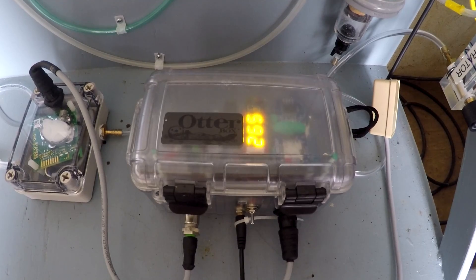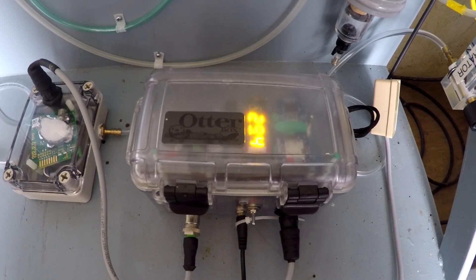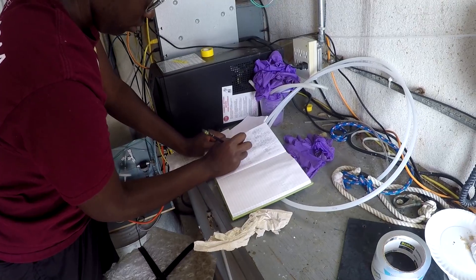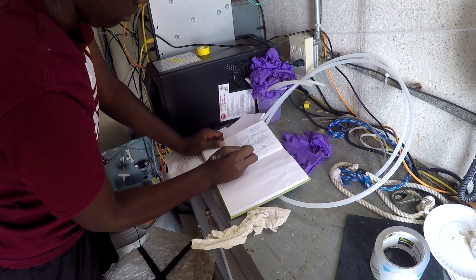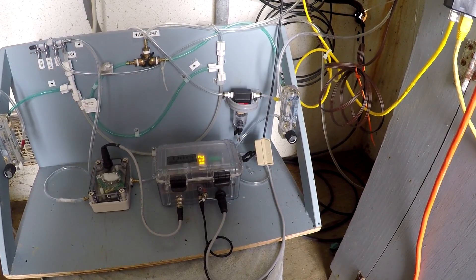The most innovative thing I suppose has to do with cost. Historically these have been really expensive instruments. What we've tried to do is use modern and more economical components for the instrumentation and also to scale the size down.